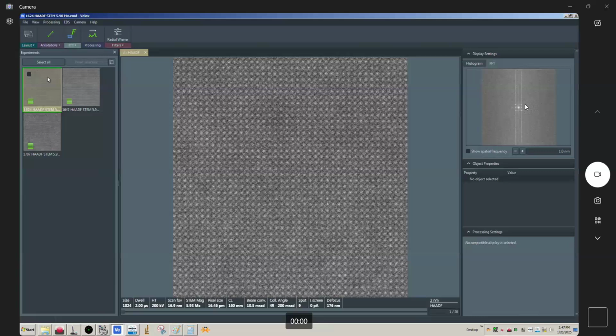So this is a series that I acquired from good old strontium titanate along the 001 zone axis or any permutation thereof you would like. And this is a 1K by 1K resolution, and this is 2 microsecond dwell time per frame. So that's going to translate to approximately 2 seconds per frame. And this was taken on the Talos, so this is not taken with a CS corrected instrument.